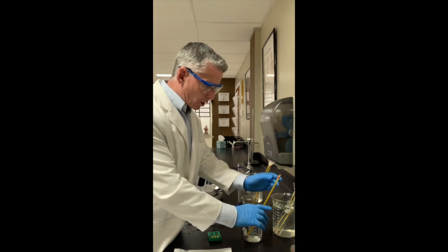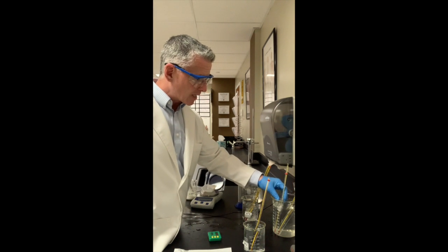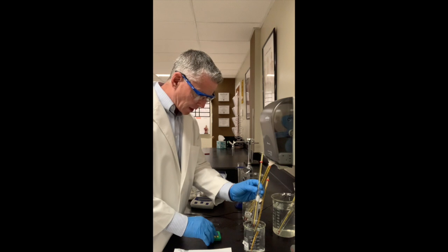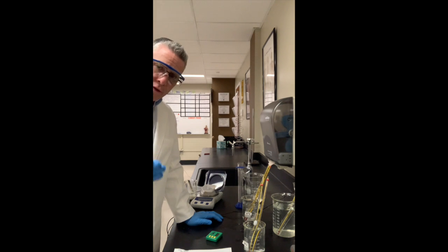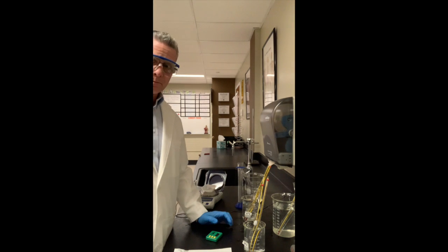I now have a water bath here at 25 degrees. I am going to take the next test tube representing my faux Ana. It is going to be at 37.5 degrees. I am going to start my timer, and I put it in here. I will record the temperature for 1 minute. I'll put the video on pause. You get the idea. I will record the temperature every minute for up to 20 minutes or until I get the same temperature reading 3 times.